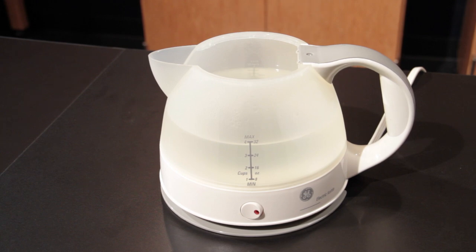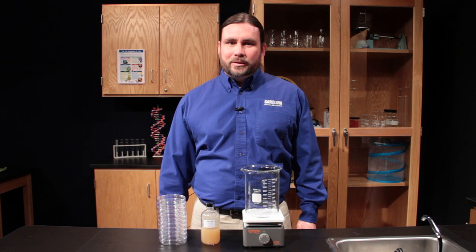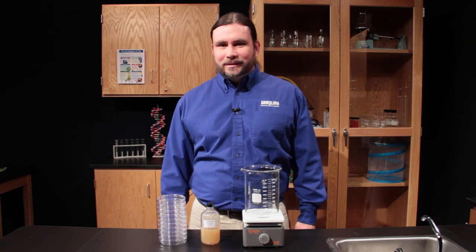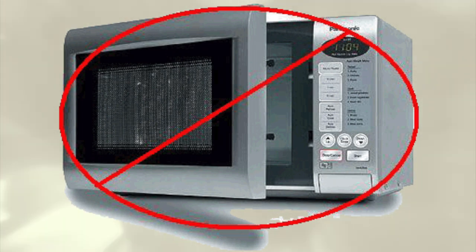You will need a boiling water bath. I'm using a simple hot pot. Be sure not to preheat your water because if you do the bottle may shatter when you put it in. Don't use a microwave as this can make a steam bubble in the agar and cause it to boil over in the microwave.